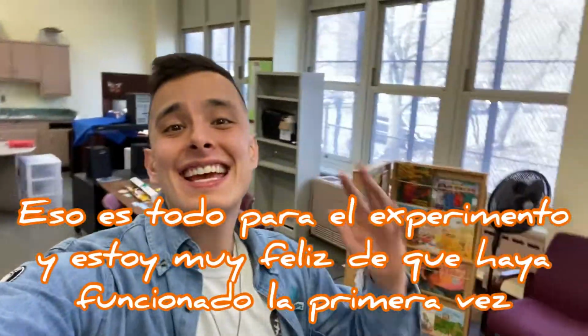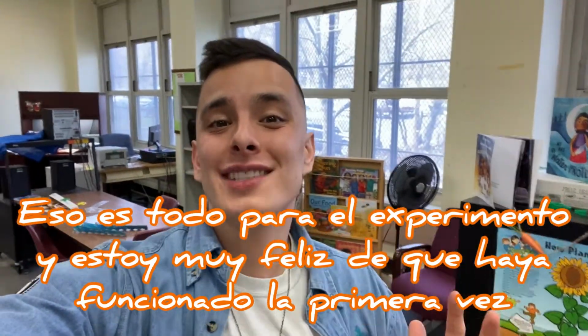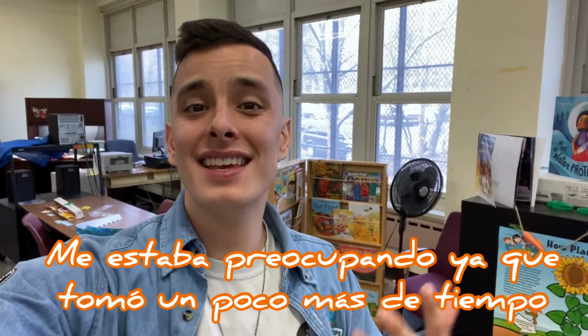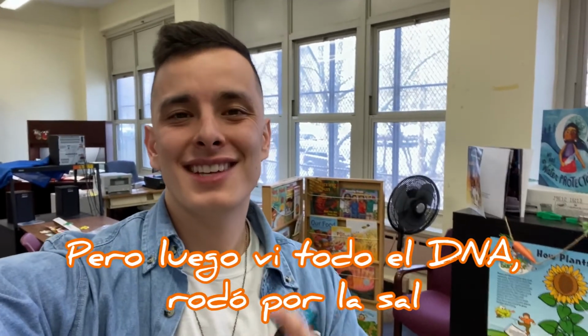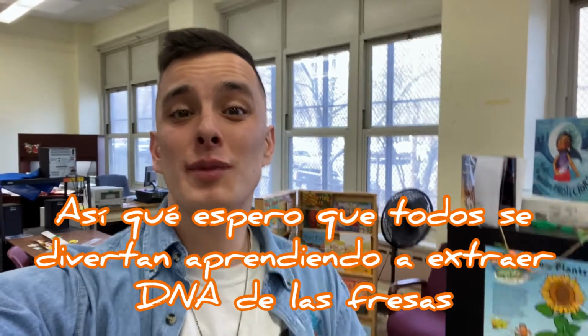All right, y'all, that is it for the experiment, and I'm honestly super happy that it worked out the first time around. I was getting worried. Usually it should happen in a few seconds, but I waited like 2 minutes, and then I saw all that DNA clumped up together, and all because of that salt. So amazing. So I hope everyone had a really fun time learning about how to extract DNA from a strawberry.